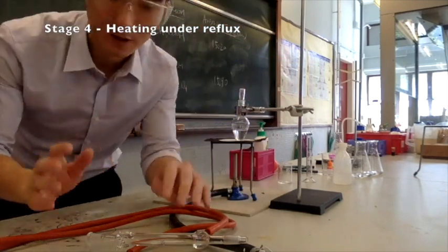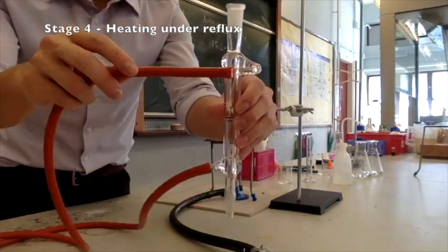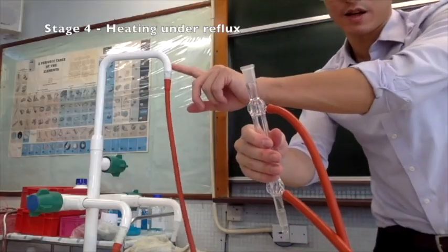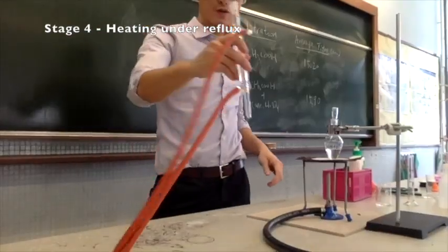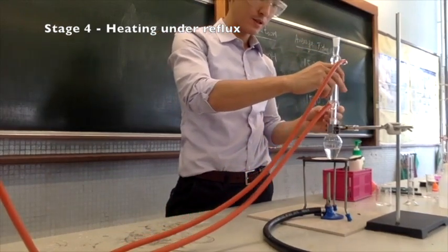Okay, the next item would be the reflux condenser. Remember, the water should get in from the bottom and get out from the top. So water in at the bottom, and the water out here, this one. All you have to do is put this one on top, like this. Okay?